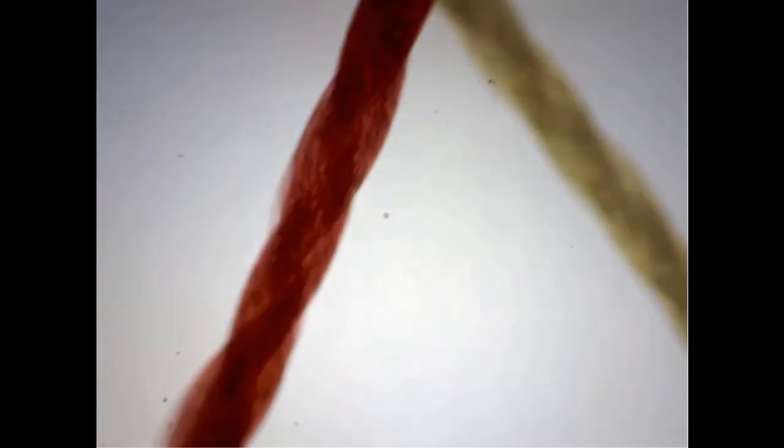Now suppose we wanted to look at the ends of the threads. We can do that by manipulating the mechanical stage knob to move the microscope slide around the stage.